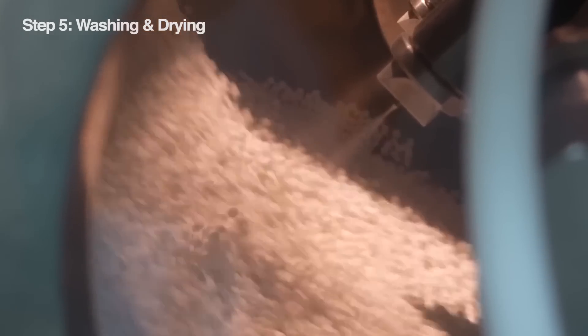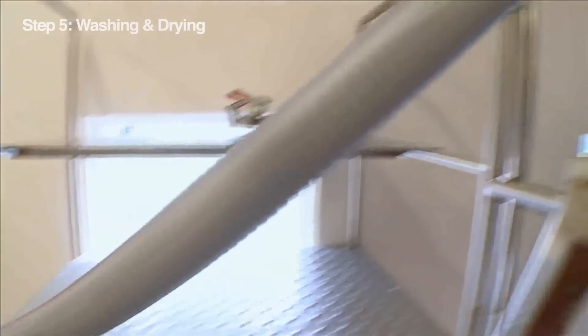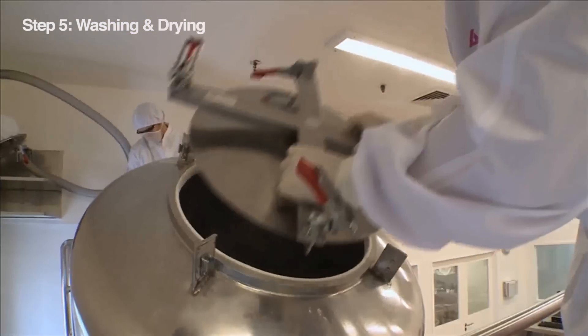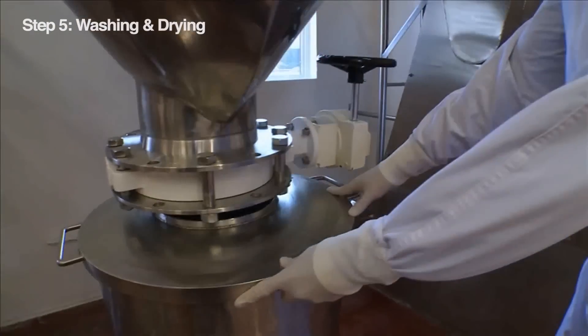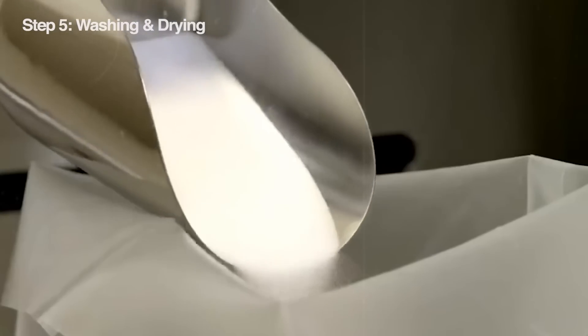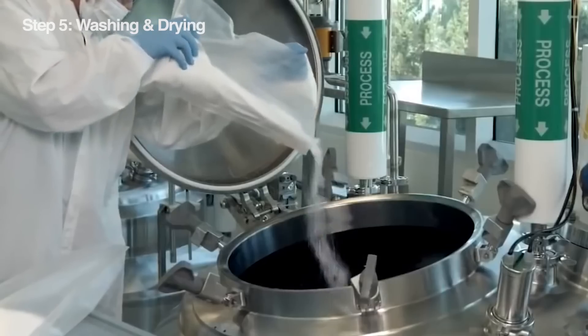We've filtered out the big chunks of leftover ethanol, but there might still be some tiny impurities clinging to the aspirin crystals. Here, we give our aspirin a final rinse with a solvent or water to make sure everything unwanted is gone. There are two main ways to do this final wash: we can use a spray washer, which basically gives the aspirin crystals a shower, or we can use an immersion tank — like dunking the crystals for a full-body soak. The key is to make sure the cleaning solution reaches every nook and cranny. They might even get a double wash just for good measure, leaving us with sparkling clean aspirin crystals.